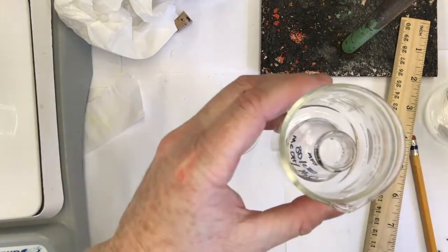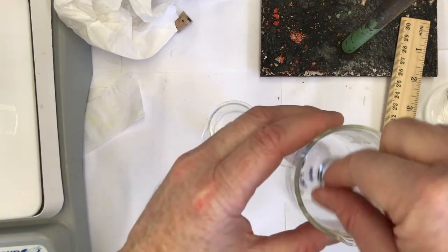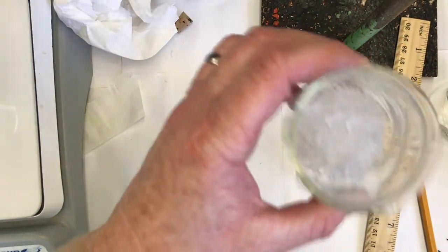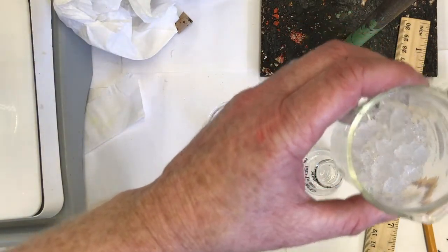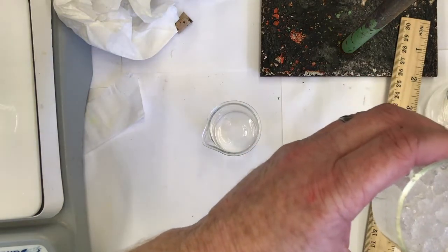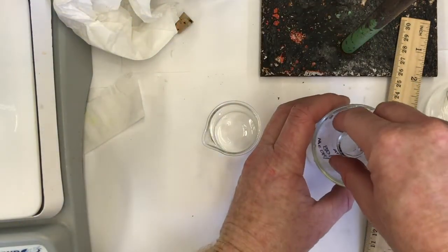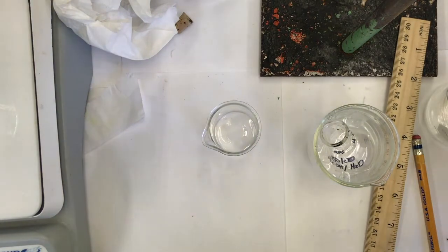It shouldn't be too big, and it can't really fall over, which is what I want. Now I'm going to put some ice water in this. I've got a little ice in there, not too much. If I add water, it will cool my solution faster because it'll have more surface contact with the flask. I put my Erlenmeyer in there, so now it can't fall over, and it's being cooled nicely.